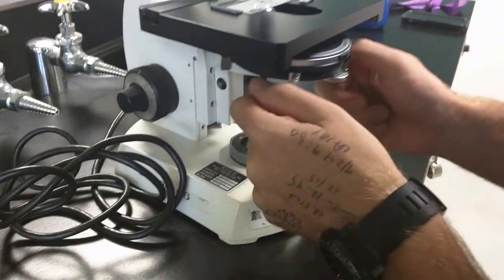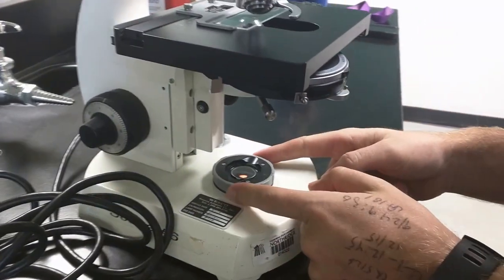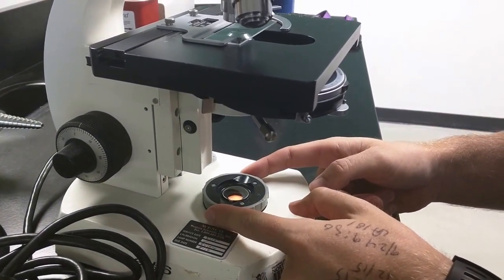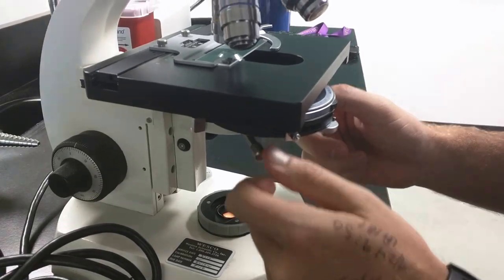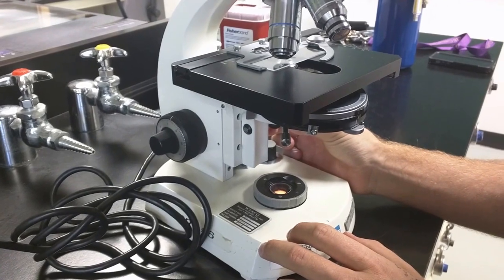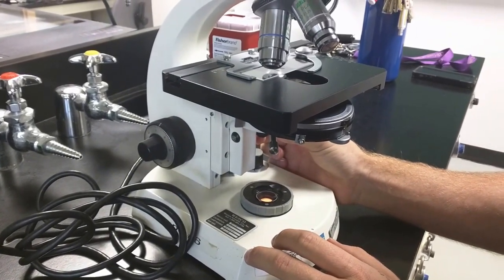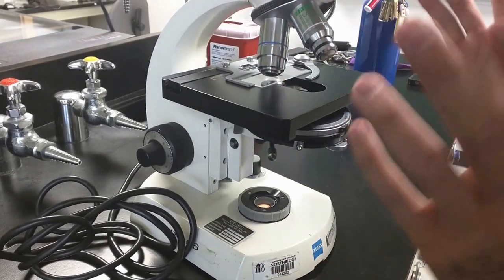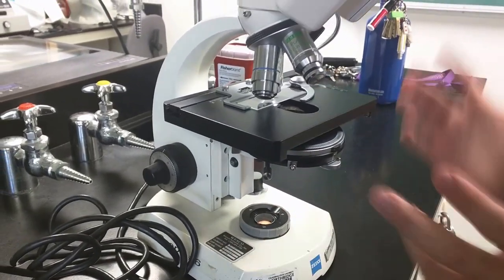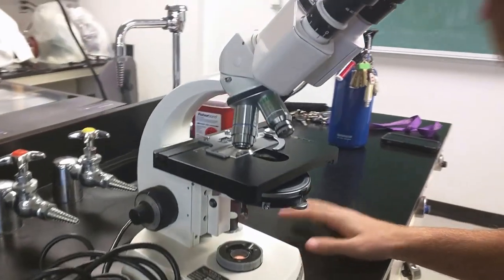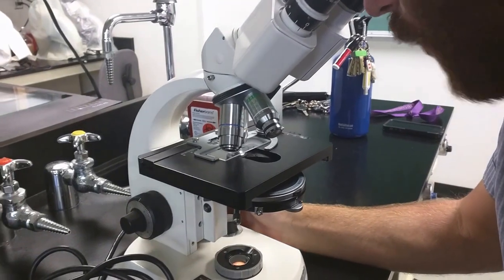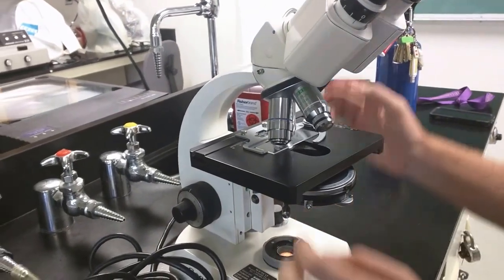Looking through. Re-center it a little bit. Re-adjust. Open it a little more. Re-center. Open it a little more. Until the corners of my hexagon are touching the outside of my field of view exactly. So now I have that sharp hexagon in focus and the corners are touching my field of view. I'm going to expand it just a little bit more so I don't see any darkness. And my whole field of view is illuminated. At this point my scope is aligned at the 10x. My wax pencil is still in sharp focus.